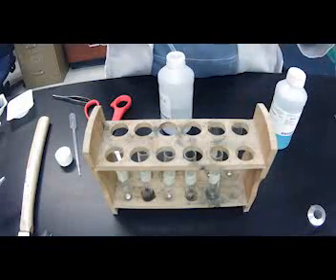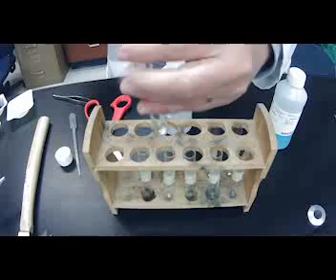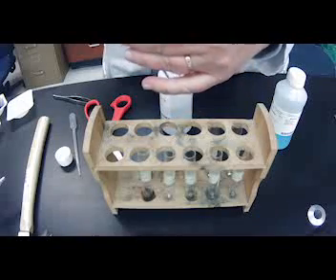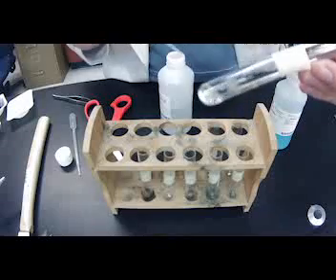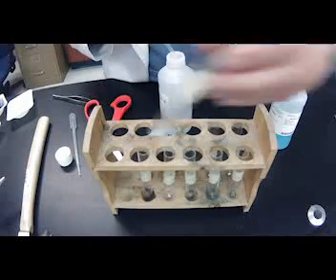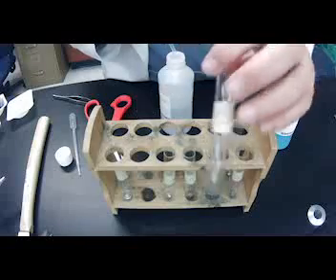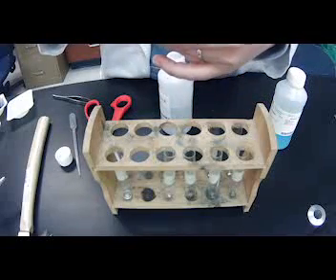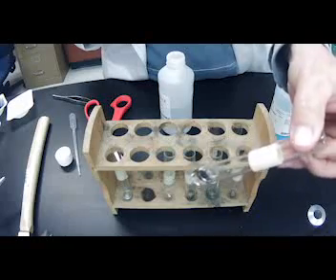I'll start at the top here. We're going to do aluminum. And chemical reactions means that there's bubbles, okay? With hydrochloric acid, there really isn't any reactivity with aluminum. This one is going to be with carbon. I'm not seeing any reactivity with carbon. No bubbles.